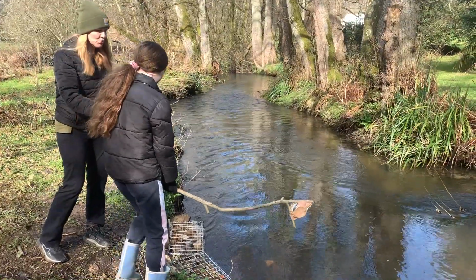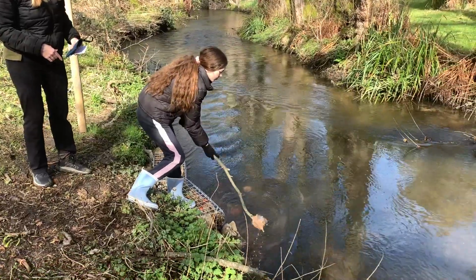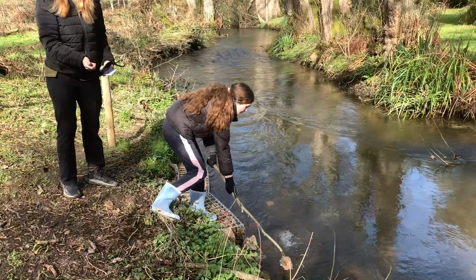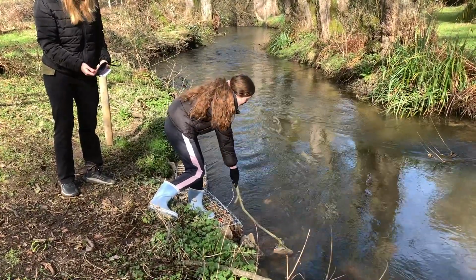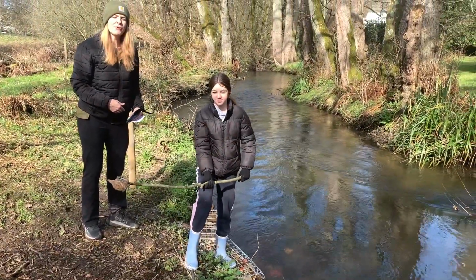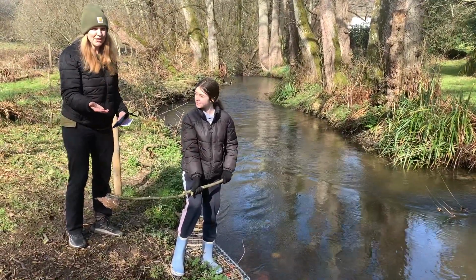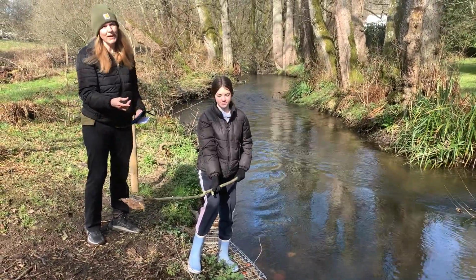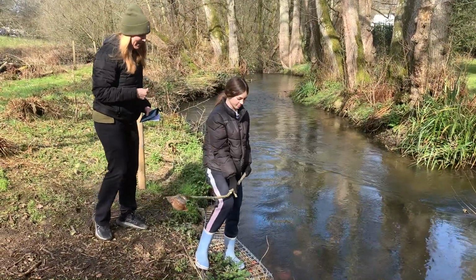So she's going to rinse the sample cup 3 times in the water that we're going to be testing. This is going to take out any of the residue that might be in the cup, but hopefully you well cleaned it before. So now she's going to take her sample. She's going to try and get about 15 centimeters below the surface. At your location though, the water might not be that deep. So we want to take it as deep as we can, about 15 centimeters, without scraping the bottom.